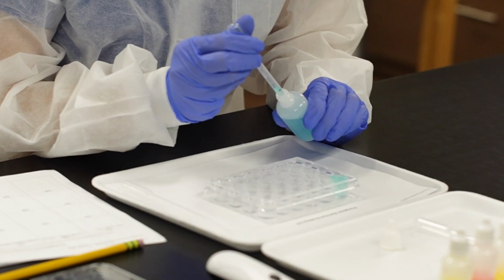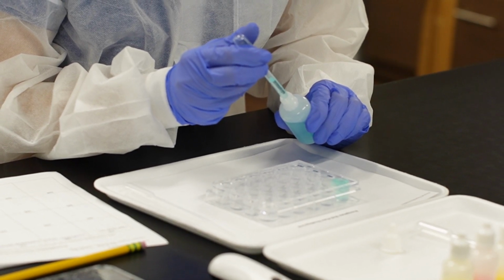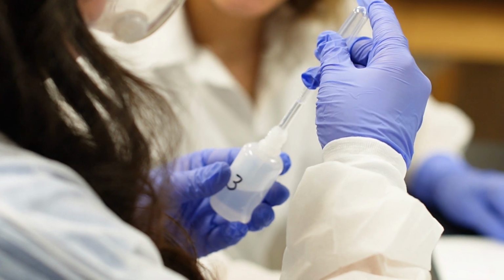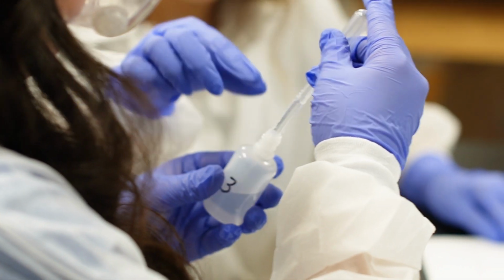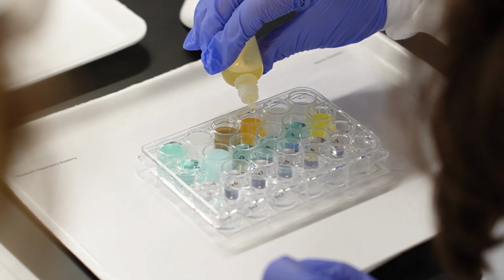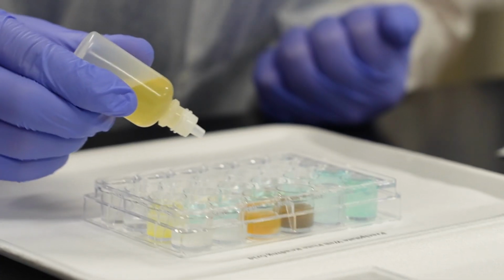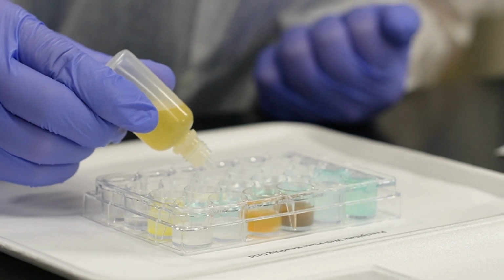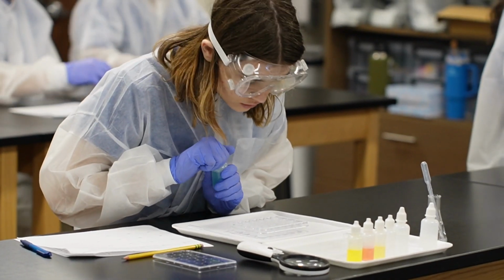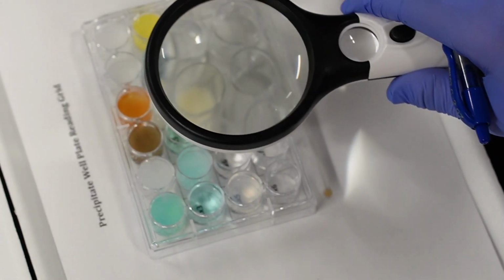Today it was the preparation required to have to use a great many different flasks and vials and such, obviously analytical balances and such to prepare from dry crystalline form the actual solutions at the right concentrations. Then they use what's called a reaction well. It's really easy because it gives them a nice controlled space to be able to mix the different chemicals without having to worry about large volumes and disposal and such, and it gives them a nice contrast color-wise so they can really see, oh, is that pink or is that more of an orange or did that turn more red?